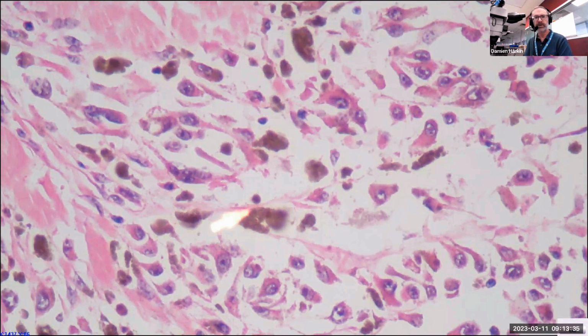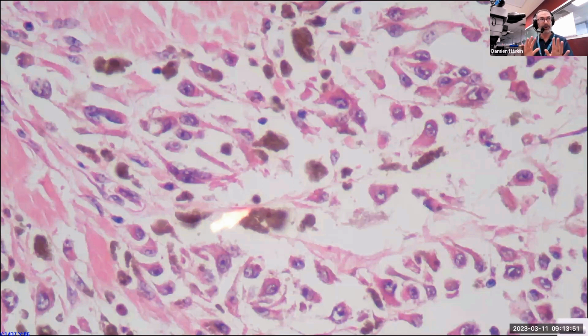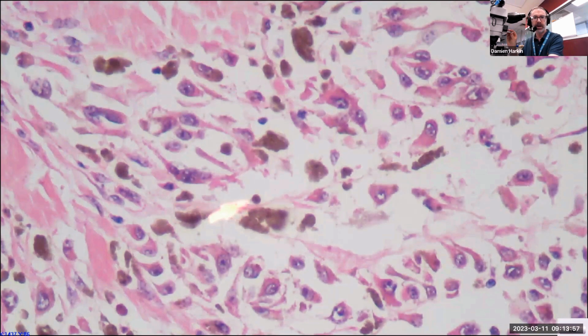Why would you want to bleach that? Well, it's a rather simple procedure. It doesn't take that long. It's basically 5 minutes in the acidified potassium permanganate, which itself is a lovely color, but you don't actually exploit that. It just oxidizes the melanin granules, and then you follow that up with a brief treatment in oxalic acid, owing to a slight discoloration of the tissue caused by the potassium permanganate. Those 2 things in combination will then lead us to this result.